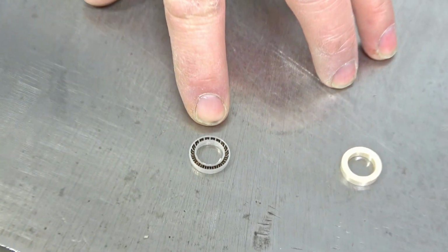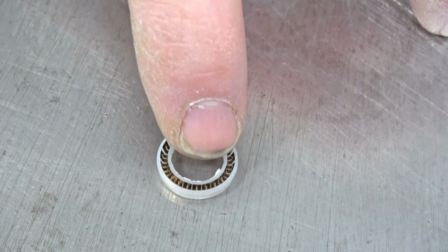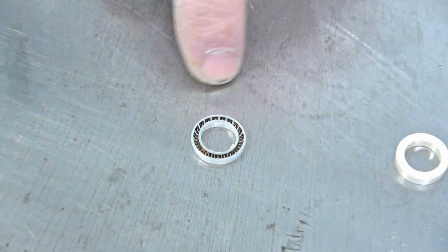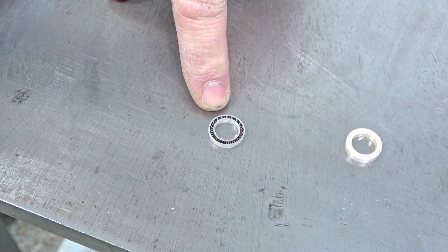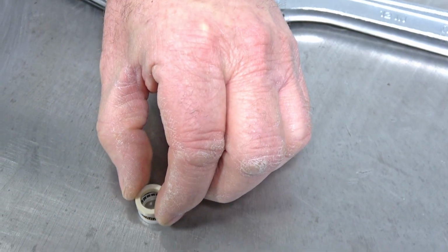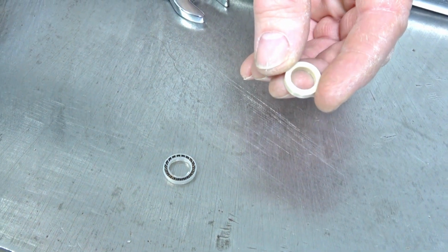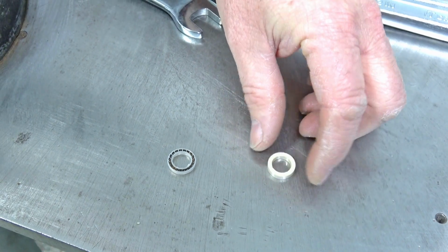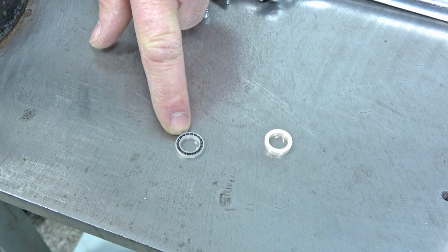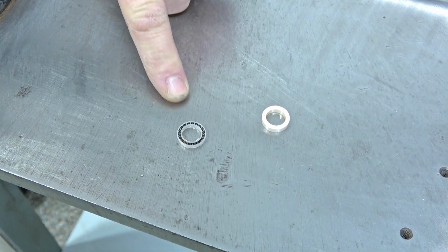You can see it's very, very small. The plunger goes inside of it, and then the outside cavity seals on the outside. And then this is just a backup seal that goes on top. If this comes out without damaging it, it will last a long time too. But this is the seal that is always going to need replacing the most, and that's the one we're going to get to.